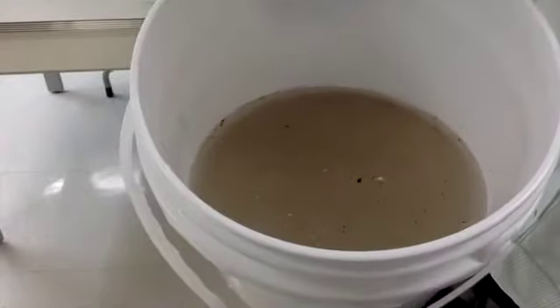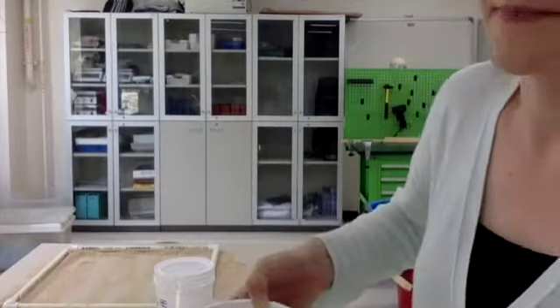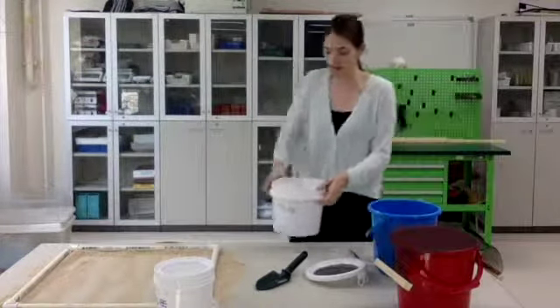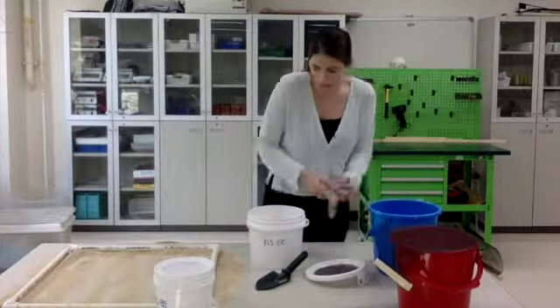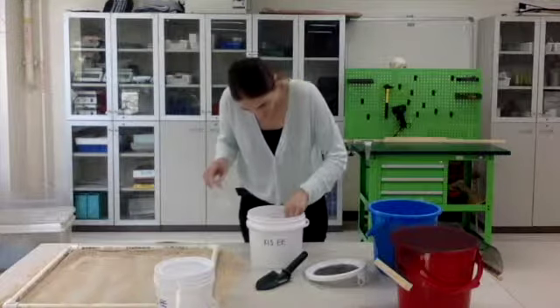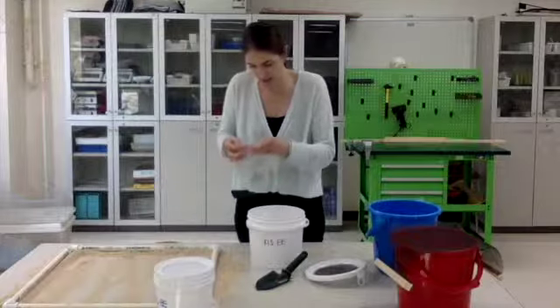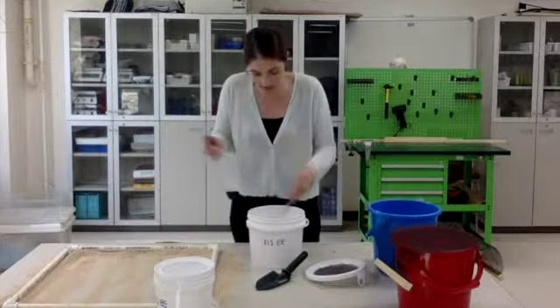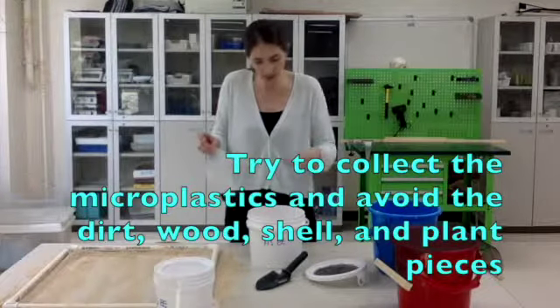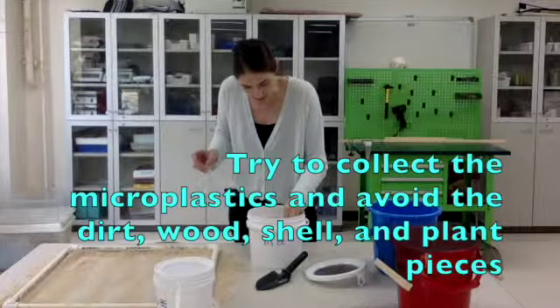There's all kinds of stuff that is floating in my water. I don't want to pick all of that up. I just want to pick out the things that I think are plastic. So again, I put a lot of plastic in here, so I have a lot to get out. Hopefully you won't have that much. So go ahead and start picking those out. It's okay if you pick up things that are not plastic because sometimes it's hard to tell. But you are going to come up with some dirt, some little pieces of wood, twigs, whatnot.